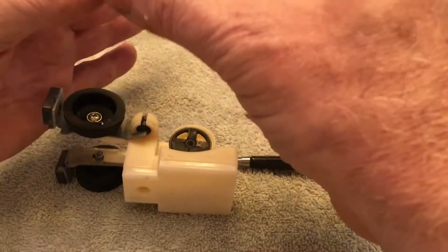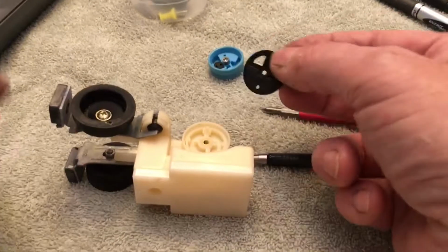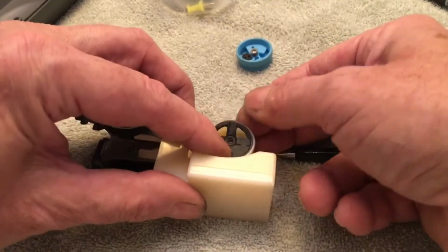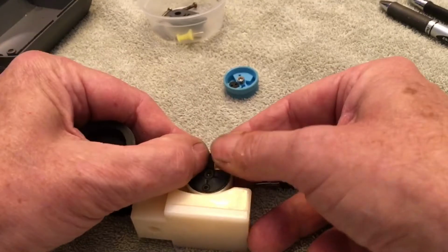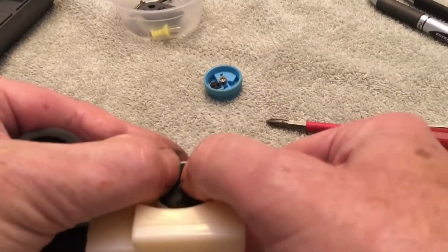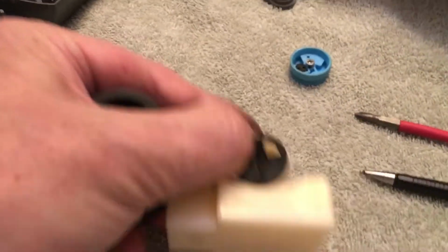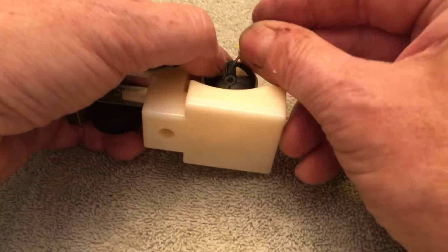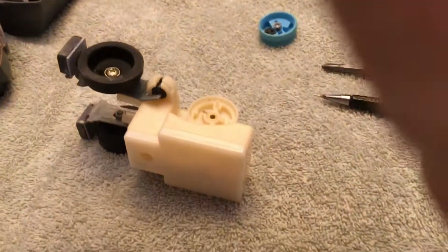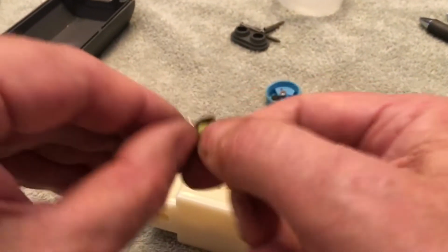We can't do that the way it is because of the pin. So what we're going to do, this one's actually pretty simple. We're going to lay this here and push, and if you can see that, you can see where the pin is. It's getting thin there. And I'm going to take a push pin and start a hole. Trying not to impale yourself. We'll get a hole started.